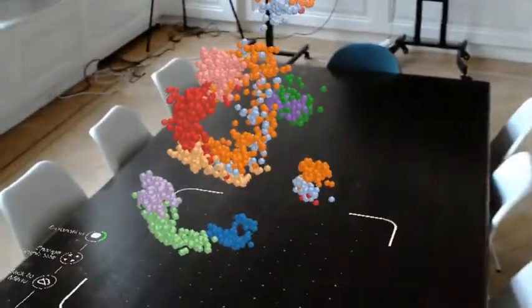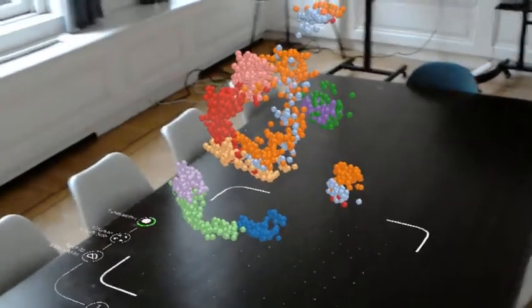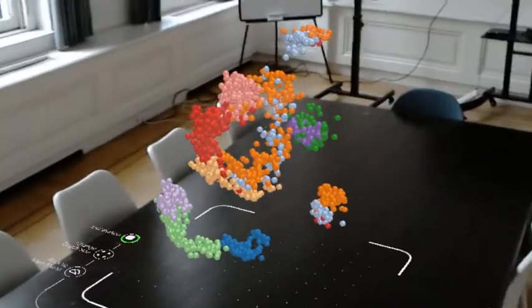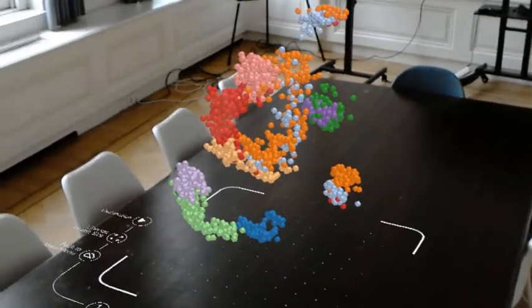So there, within 6 steps and a couple of minutes, other biologists, researchers can get a glimpse of the cutting-edge research that's been done in the Wellcome Sanger Institute.